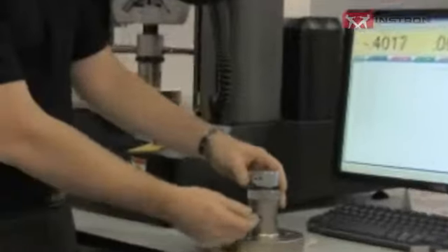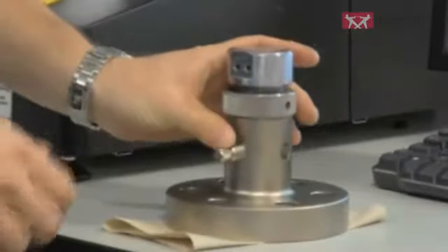Today we're going to be talking about preloading your load string. A lot of our grip connections use a clevis connection, which puts pins in double shear. However, when you first insert the pin, there's still some slack, some compliance. So what we're going to do is tighten our check nut to get rid of that compliance.